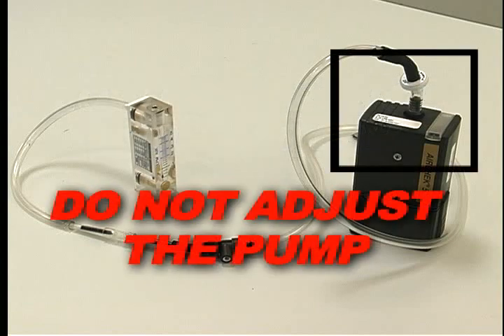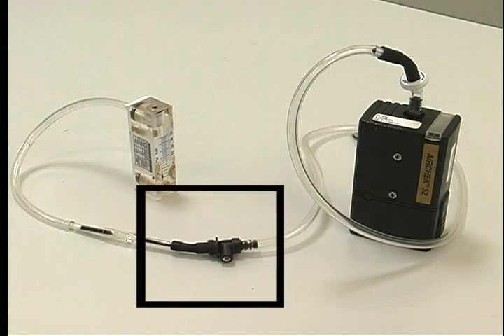Do not adjust the pump itself at any time while verifying calibrations. Only the low flow holder should be adjusted.